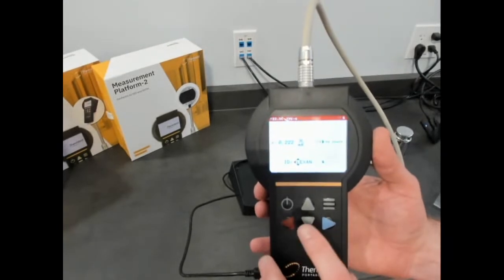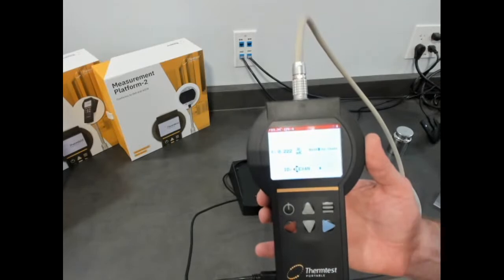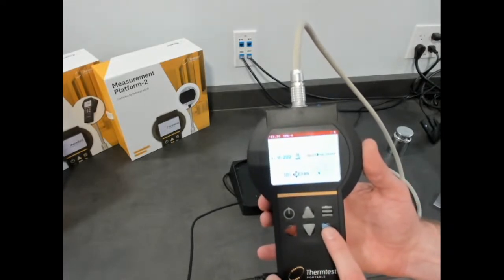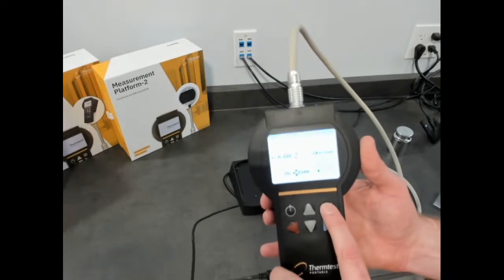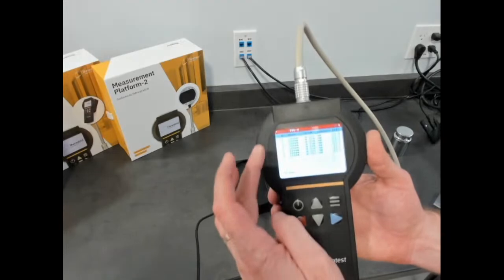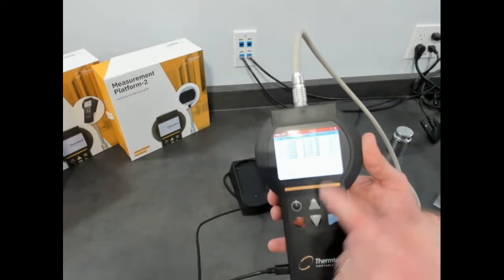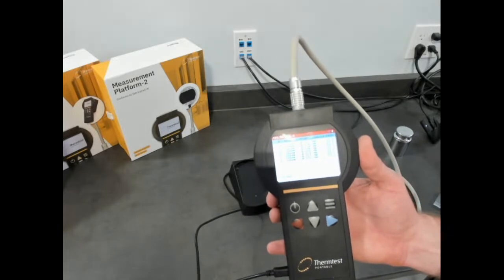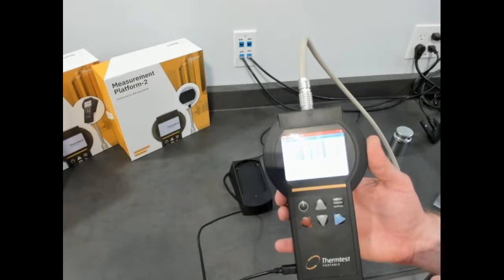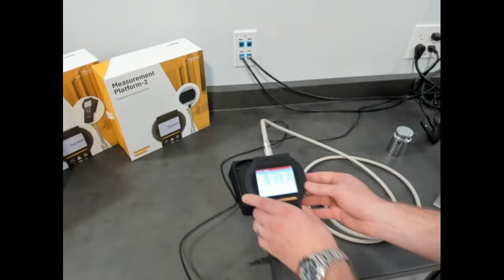So this one only generates thermal conductivity, where the other 2 MPs give you additional properties of diffusivity, thermal specific heat, and thermal effusivity. If you want to review several measurements, you can go to view data, and you can see here Lexan measured 7 times before that, and 8 is our last measurement. It's all around 0.22 at the same time and roughly the same room temperature. And we'll import that and show you what that data looks like as well.